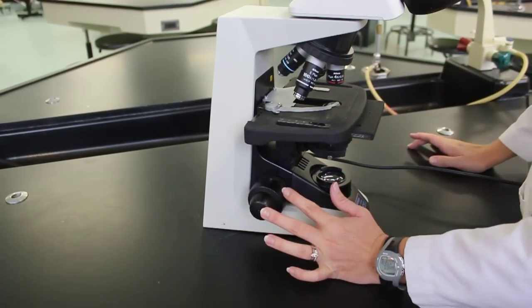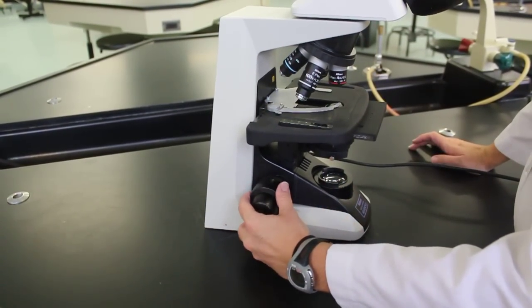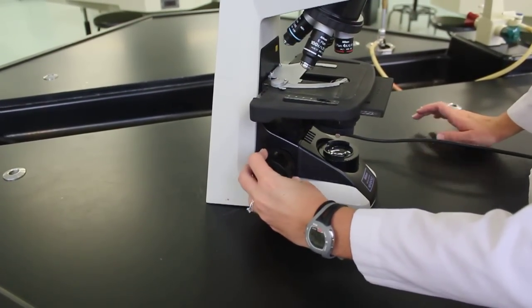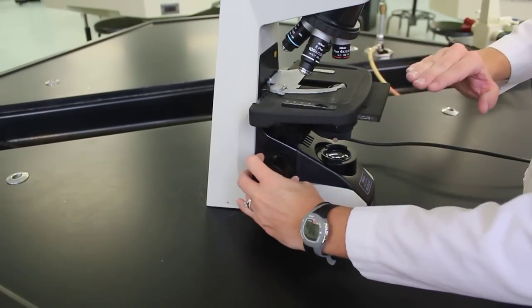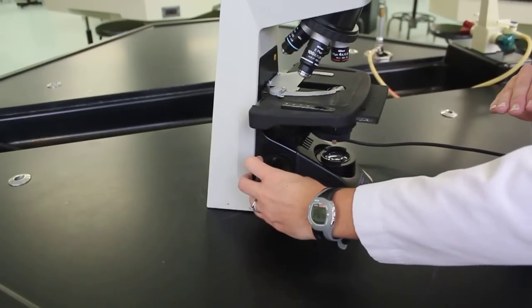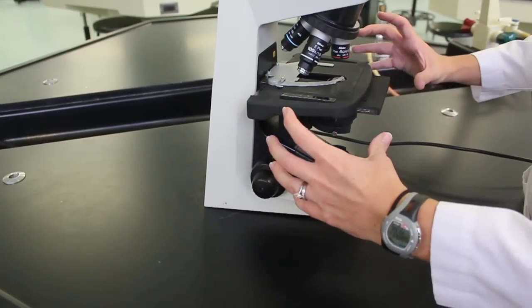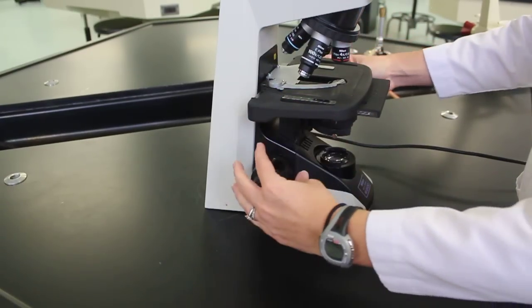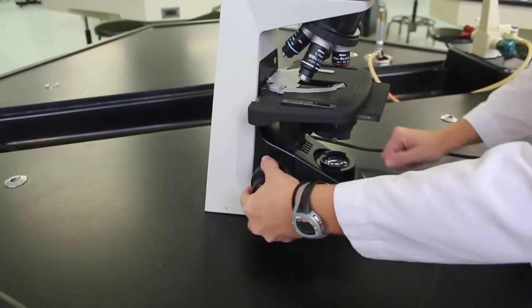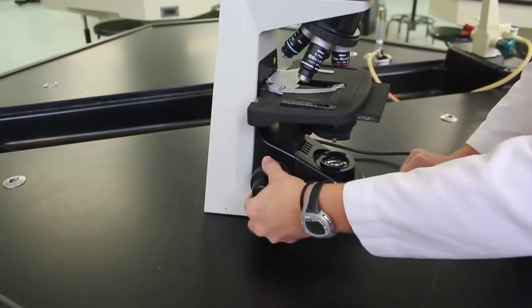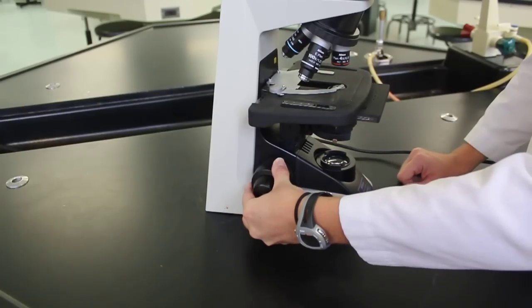These two knobs are your focus knobs. The large knob, as I turn it, moves the stage up and down so much that you can see it. You should always start with the stage completely up, meaning you have turned it as far away from you as it will go. That way, as you're focusing, you only need to turn the knobs towards you.